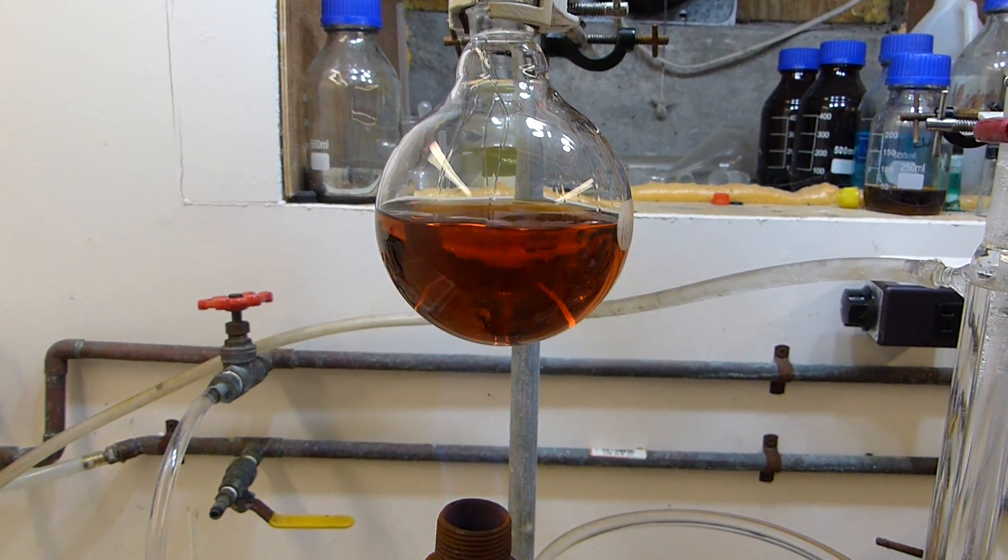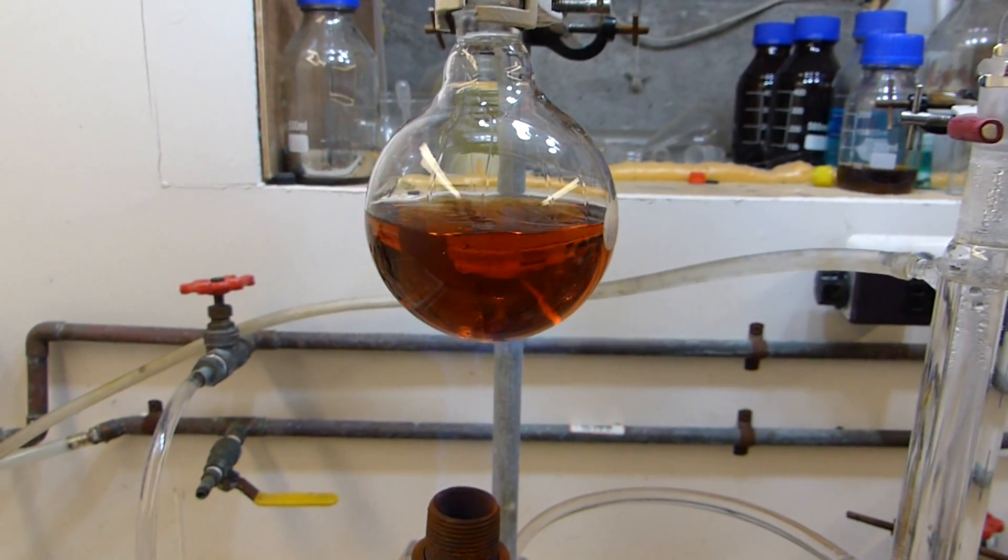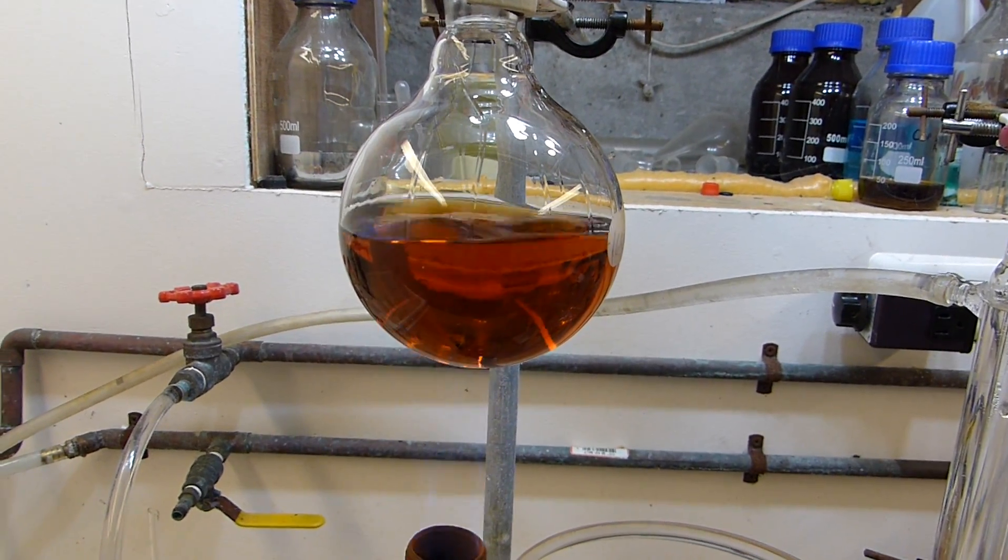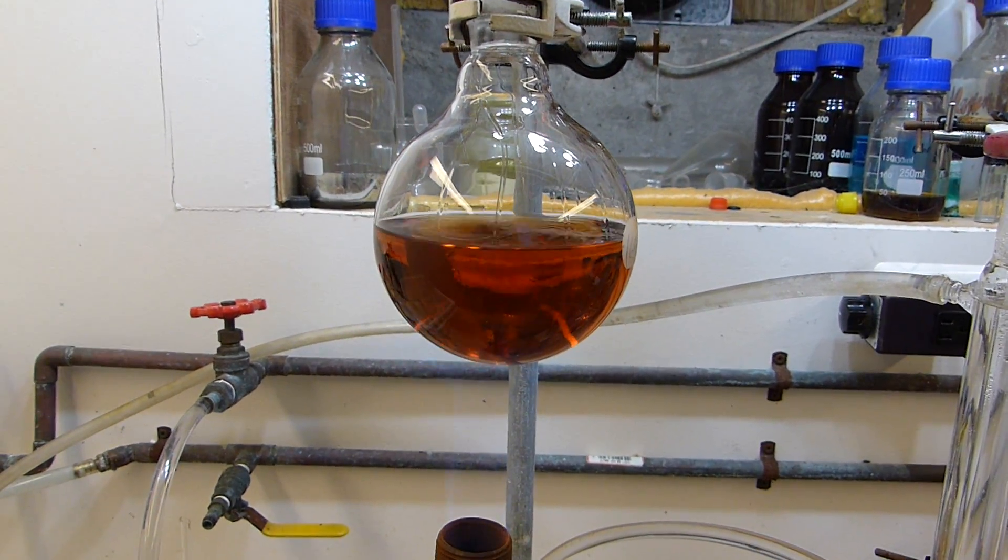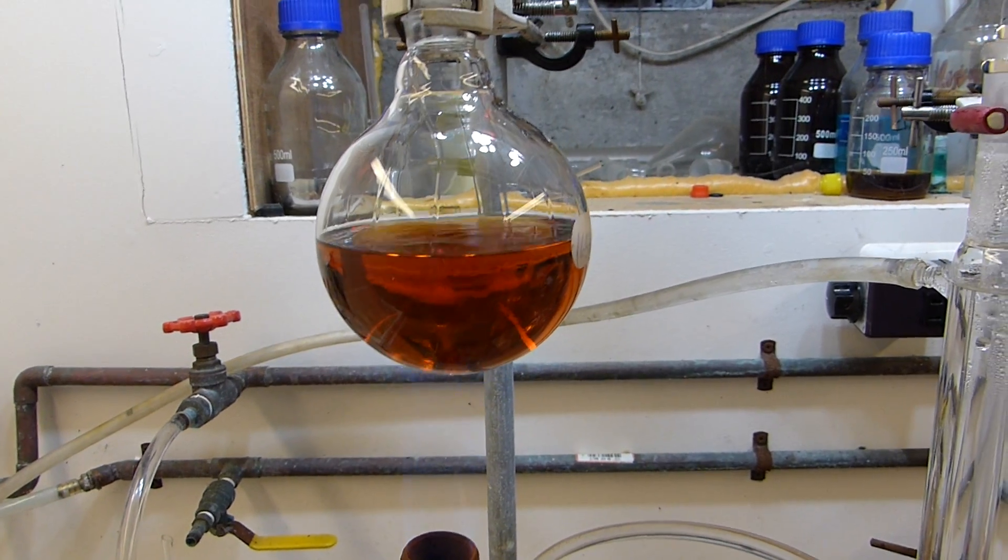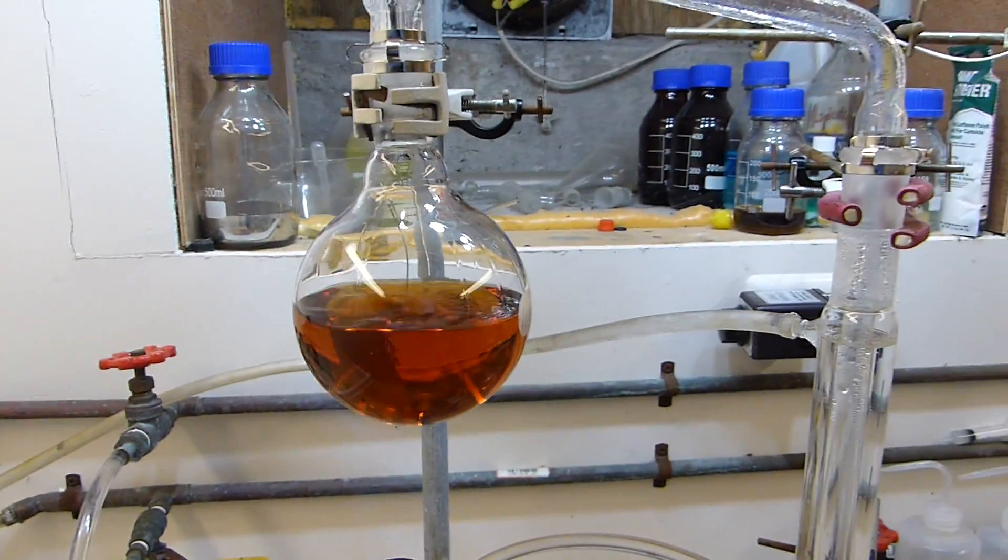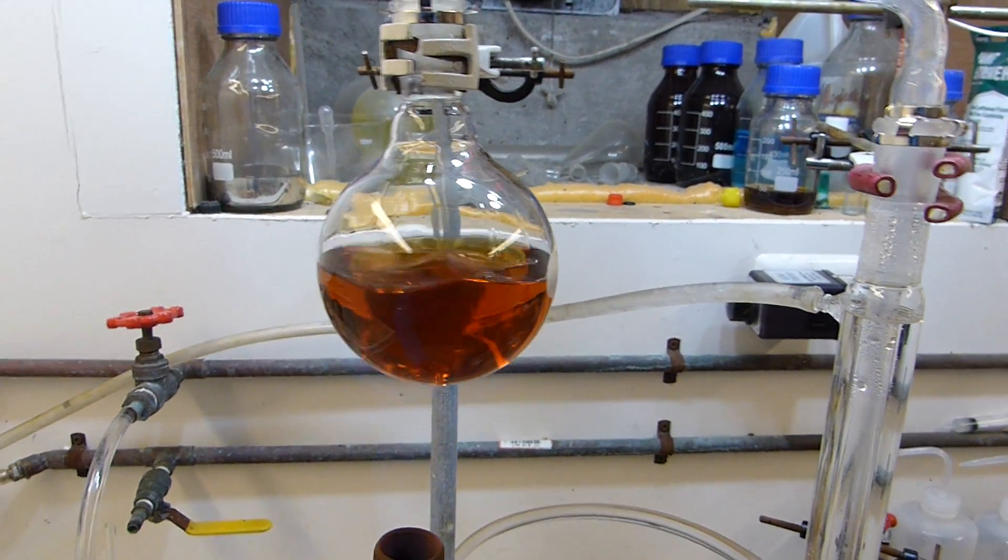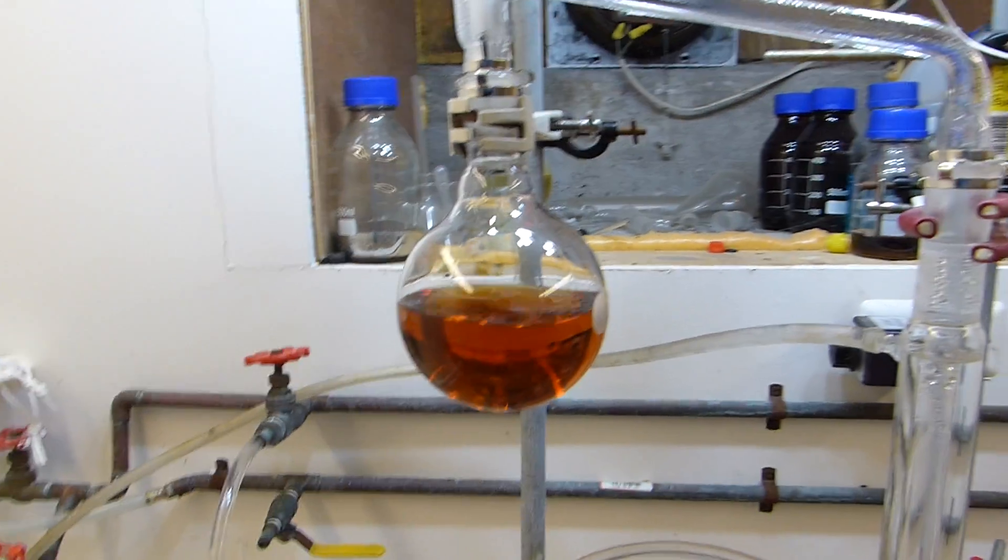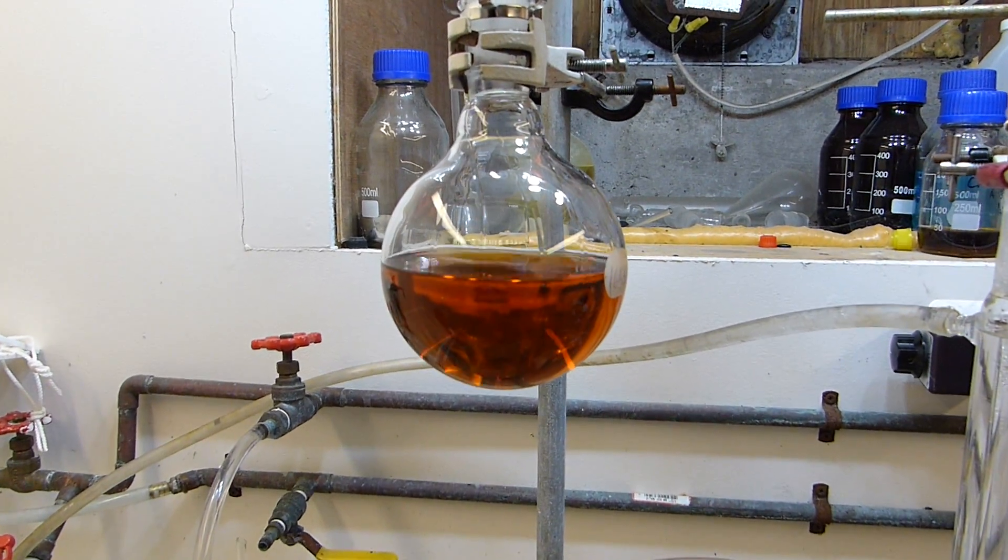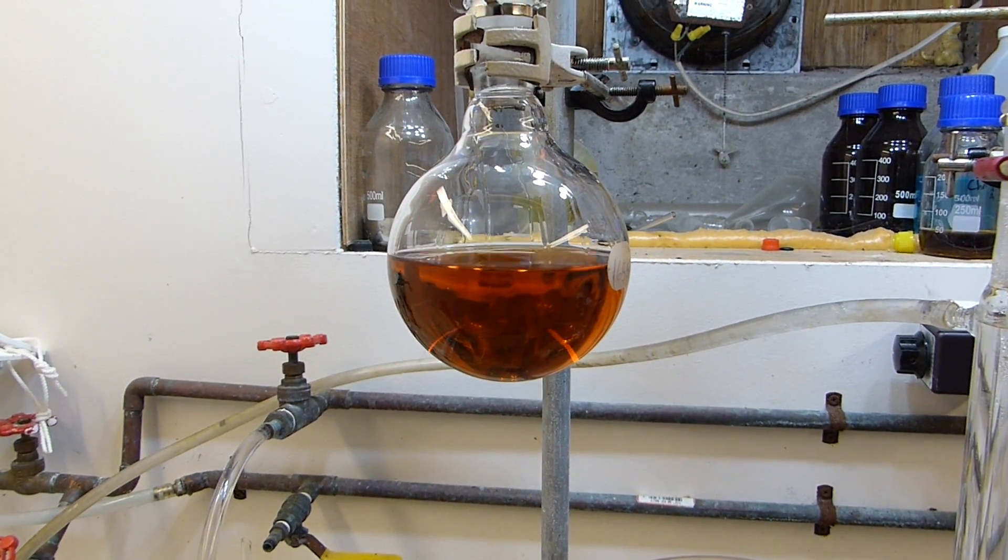All right you can see the acid has cleared up quite a bit and I'm taking over distillate at 261 Celsius. I'm running into some problems with bumping in this acid, which is some violent explosive bubbling that happens once in a while when a nucleate boiling point is found by an acid that's been superheated. So unfortunately I'm going to probably throw hot dirty acid down my condenser if I continue to go at this rate. So I'm going to have to add boiling chips to this.